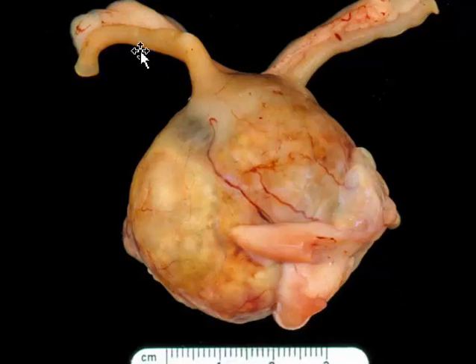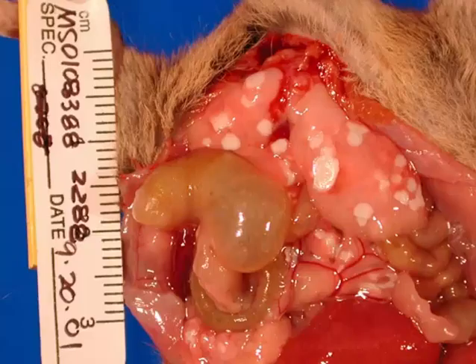Here's an absolutely amazing size of an intestinal polypoid carcinoma. Spontaneous disease in a mouse. This is fat necrosis of the omental and mesenteric fat. It's often spontaneous. It may be associated with various causes of pancreatic necrosis or the feeding of a choline deficient diet.